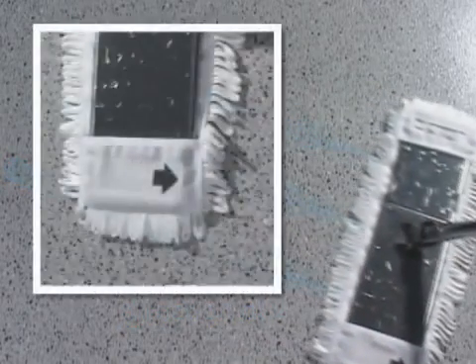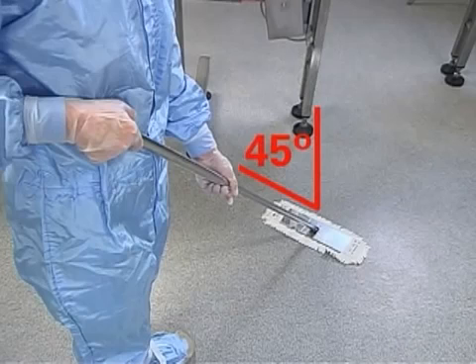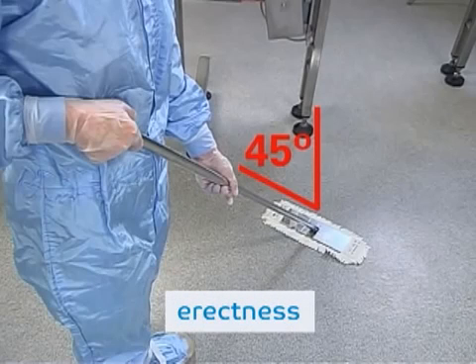The correct wipe direction is highlighted by an arrow on the mop cover. Wipe slowly and hold the mop at a 45-degree angle. This way you achieve the best results and take good care of your back.